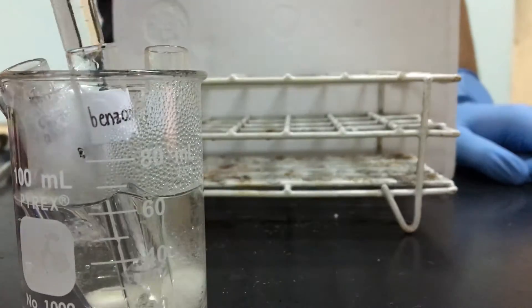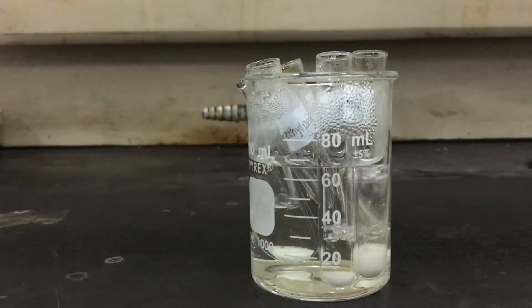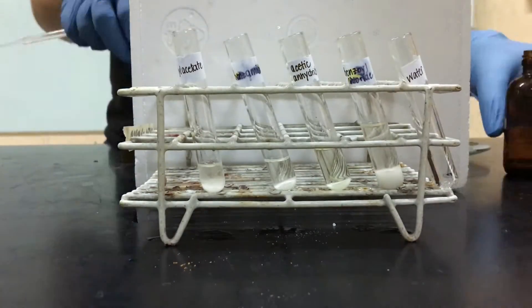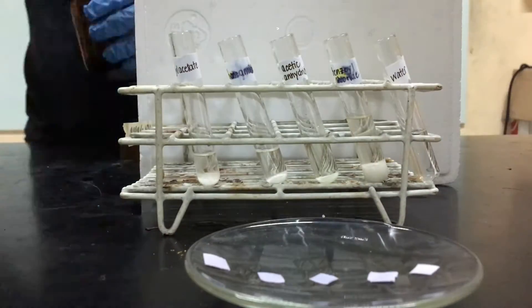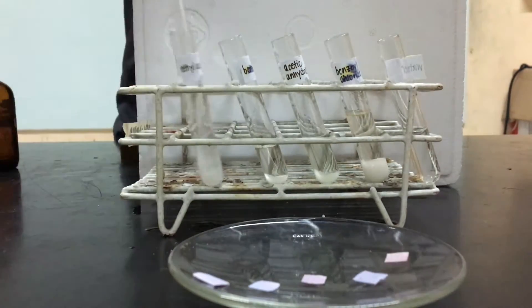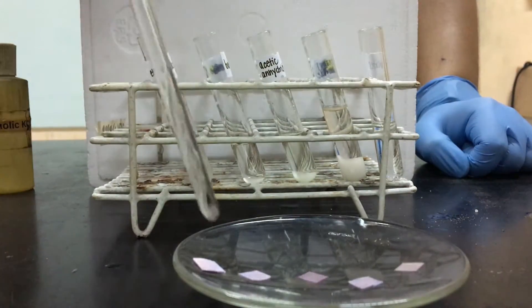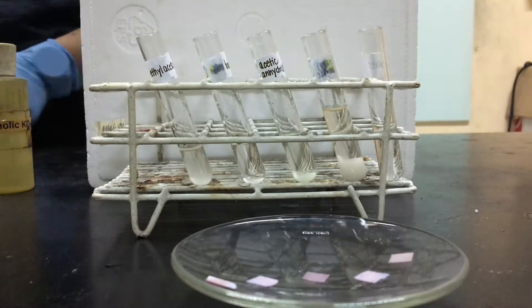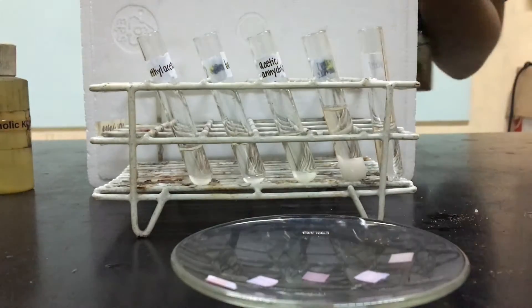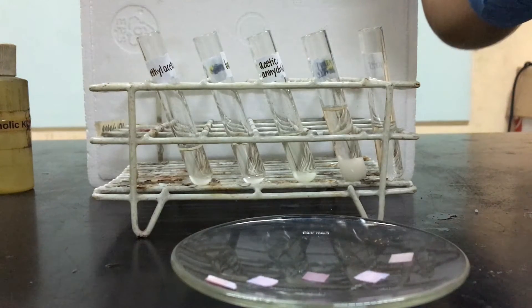We heat the solution to boiling in a water bath, then let it cool slightly. We then acidify the solution by adding 7% methanolic hydrochloric acid until the mixture turns blue litmus paper red. Lastly, we add 10 drops of 3% ferric chloride solution.